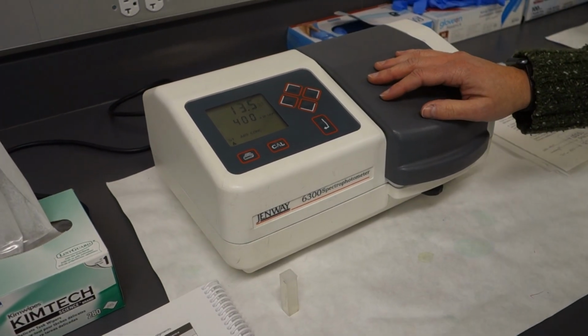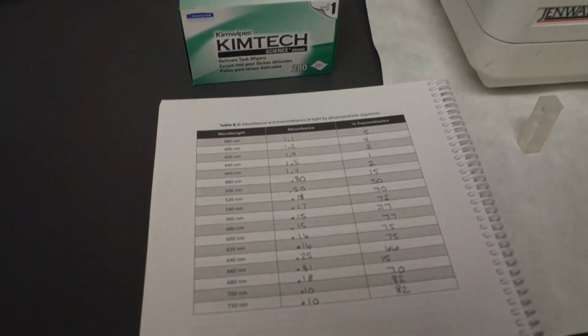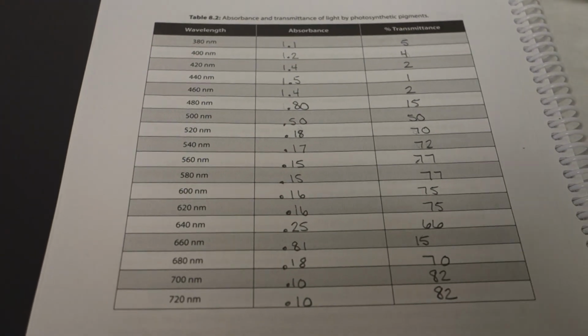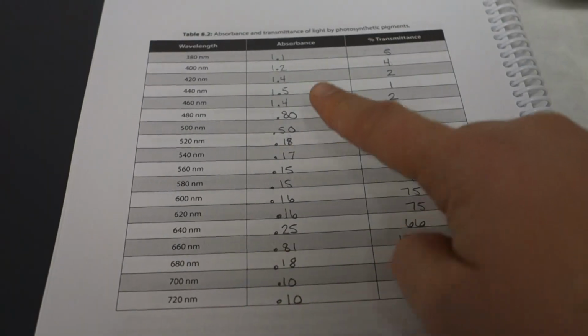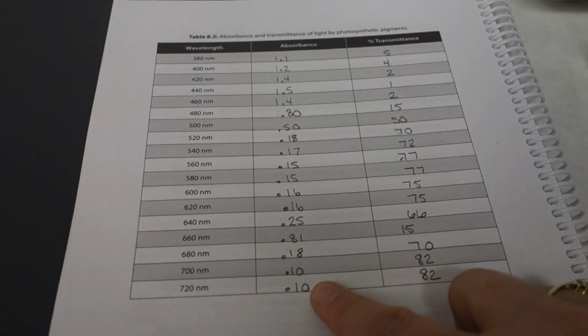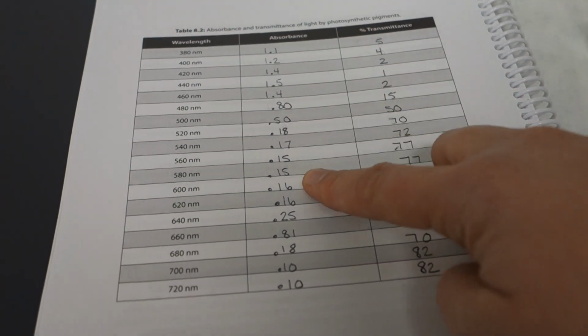So we're not going to go through all of this because there's a lot of them. If you look in your lab book, you will see that you have a whole list of all of the wavelengths that are going to be tested. And then we made up some trendy data. We just made it up a little bit, that follows absorbance through the rainbow, basically.